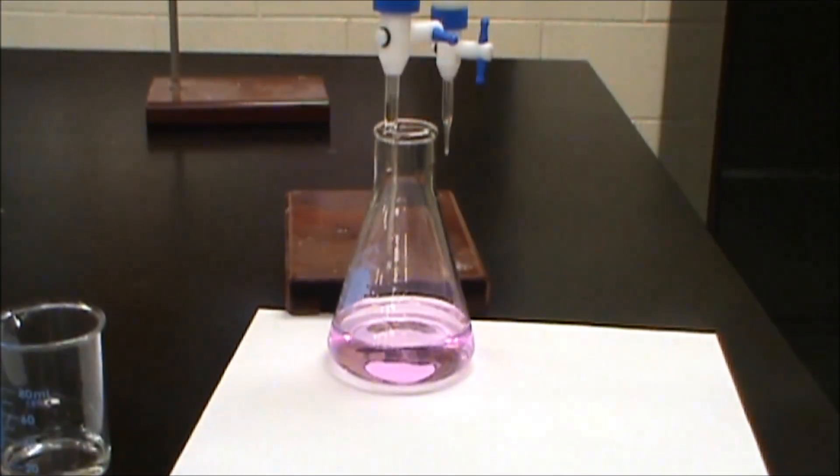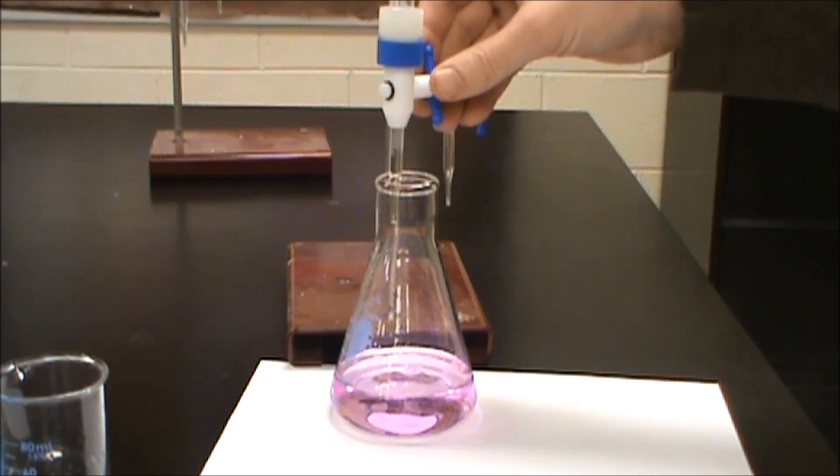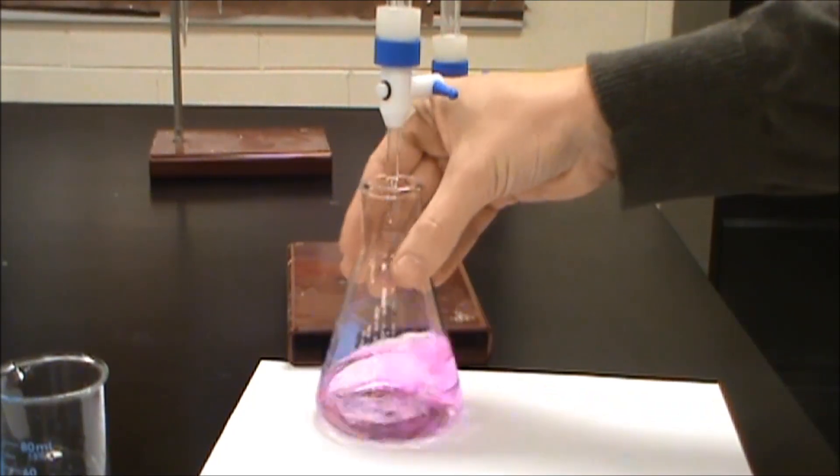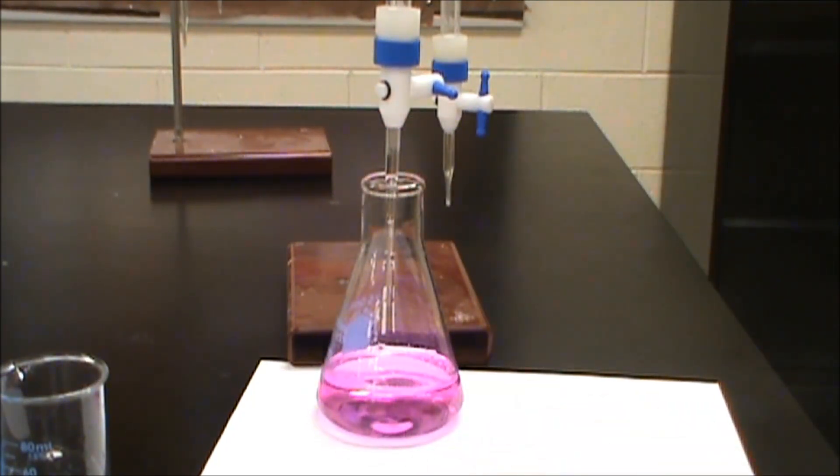And just for fun, we're going to add a couple more drops to see that pink color really shine through. So we're going to change pH rapidly there. And that takes us down to 23.25. So an extra tenth of a milliliter.